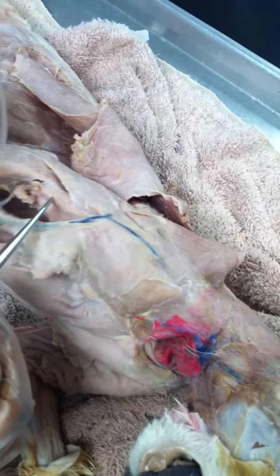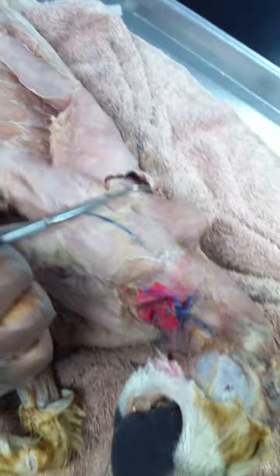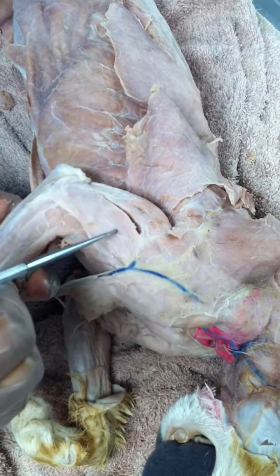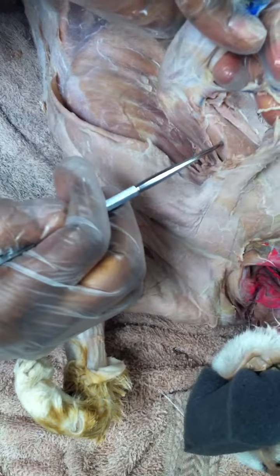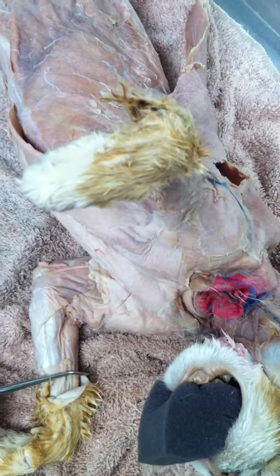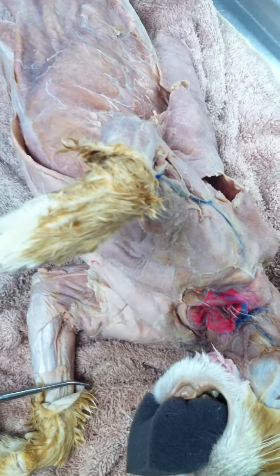And going towards the lateral side, right next to it, that is your brachialis. So I usually like to remember it as triceps brachii, long head, triceps brachii, lateral head, brachialis, and then biceps brachii. Okay. Anything I forgot? I don't think so.